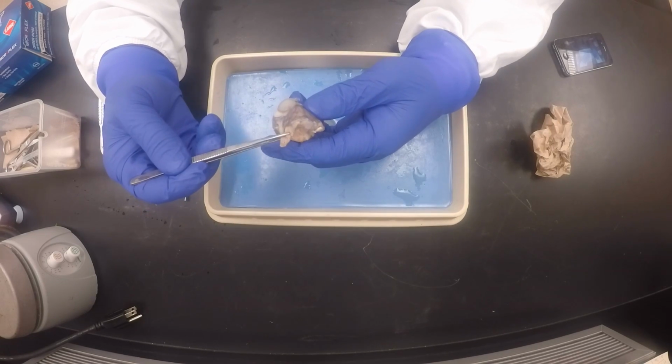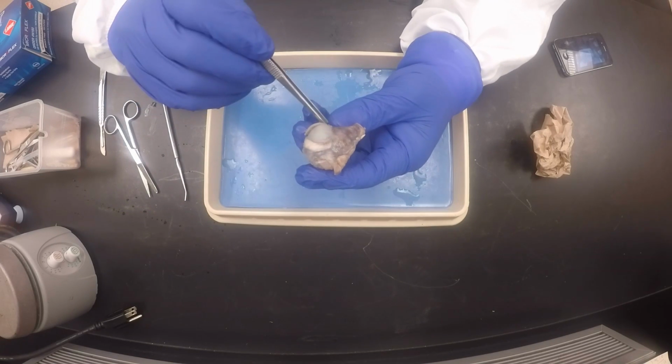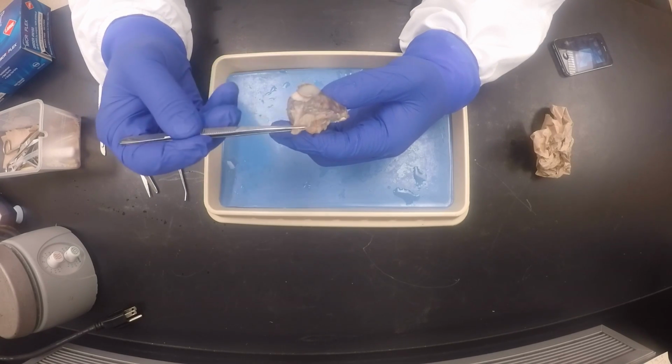Going straight ahead on the compass point, and then I see another one going at an angle, towards one of the long sides. Once you see that, you will know that the one that goes straight out is the lateral rectus.